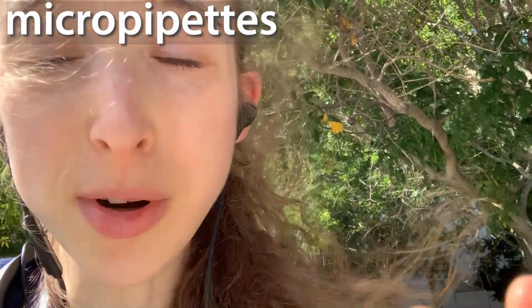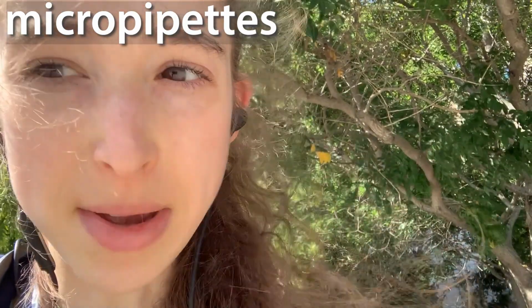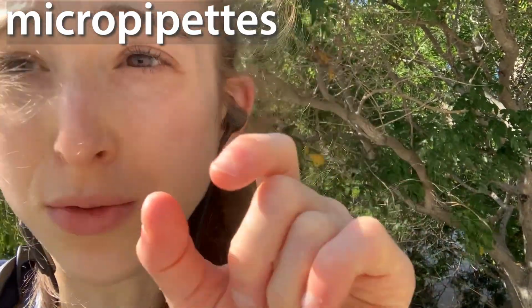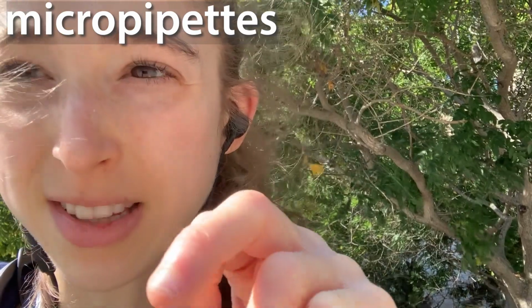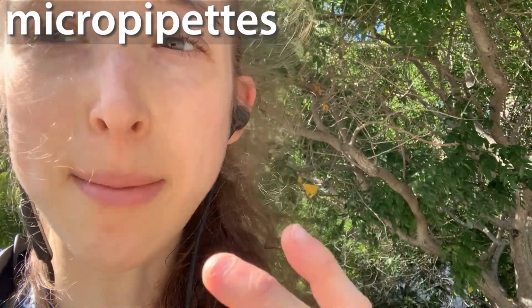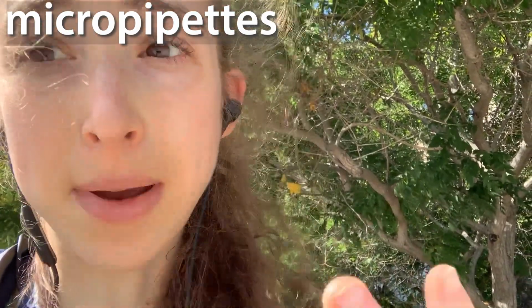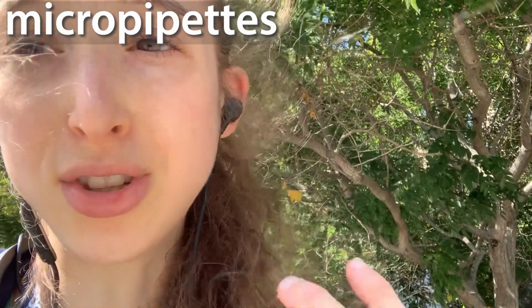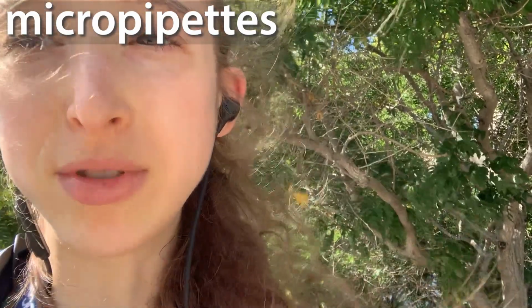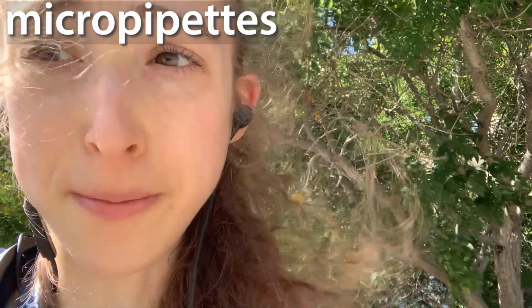But typically, when you're working with that pipette, you're going to be working below 1 milliliter, unless you're at its limit. So there are typically 2 points after the decimal in the P1000s. So if you're at 0.62, that's telling you that it's at 620 microliters. And with the P1000, you're only able to get to within a microliter of difference in your volume.